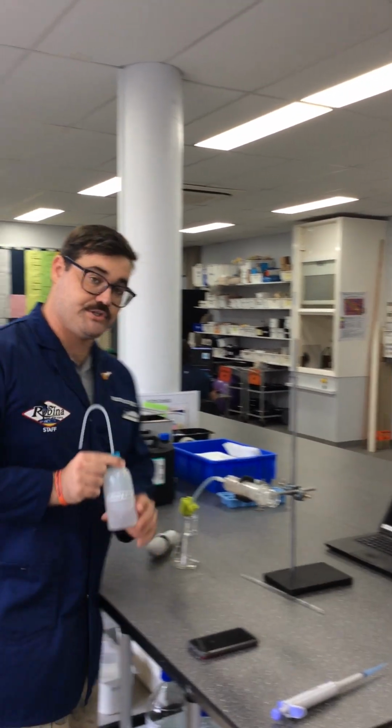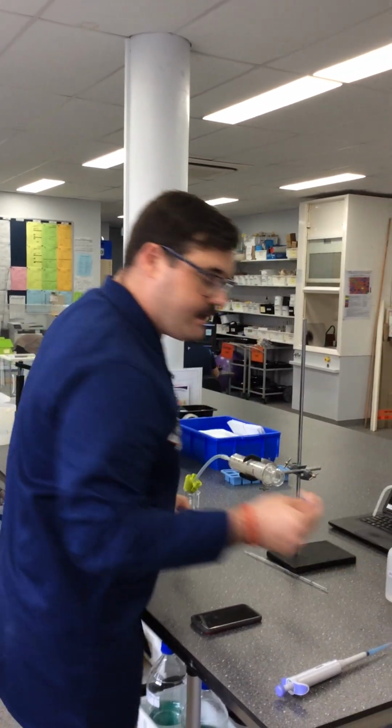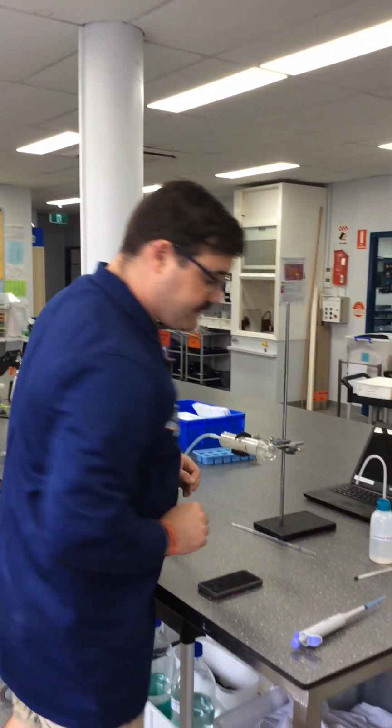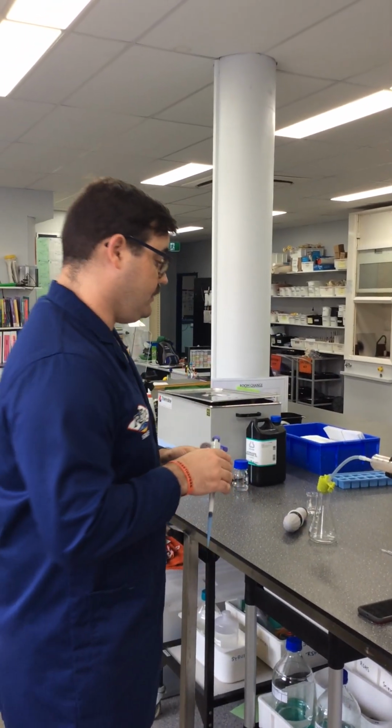We've got some other equipment here. We've got the ever important distilled water. Okay, we use this for making up solutions and rinsing. We've got a thermometer, which I've already used to test the temperature of our solution, so you're not going to see me using that today. We've got here a piece of equipment that I'll make sure that you are familiar with when we get back, and this is an automatic pipette. Okay, it's used for taking very small volumes. This one's 100 microliters to 1,000 microliters. 1,000 microliters being 1 mil. Okay, so we're going to use this today to take our samples of Catalase solution.